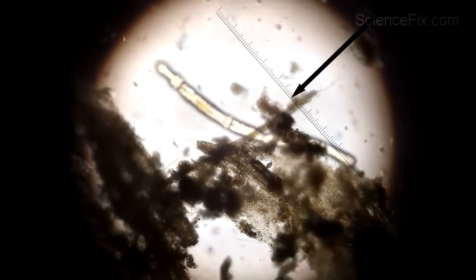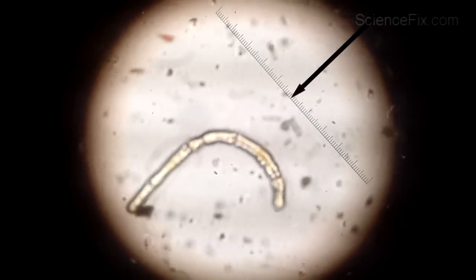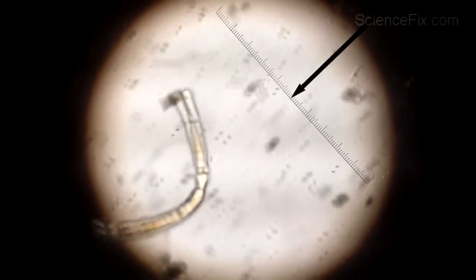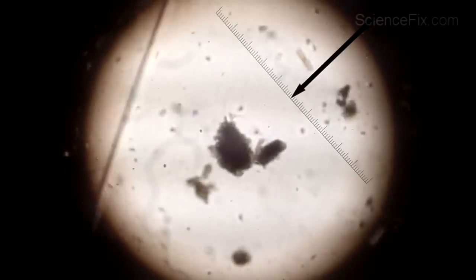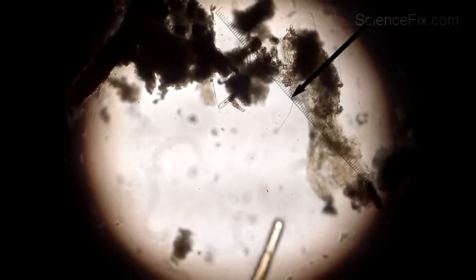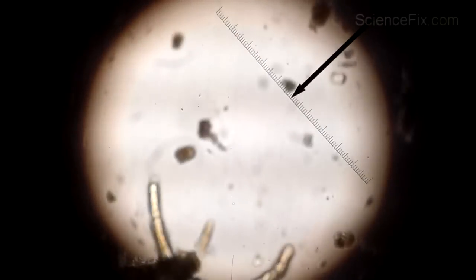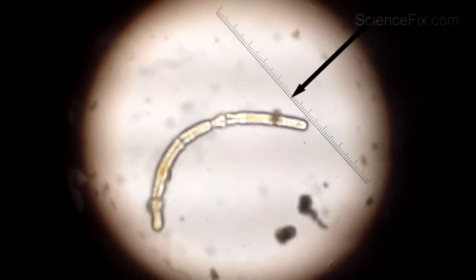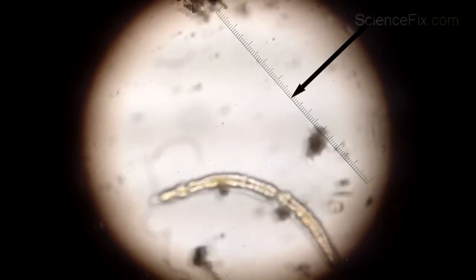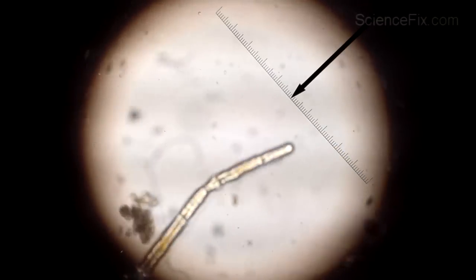It's also cool to use a little setup like this where you can record video and pictures on the smartphone and play it back later. Students are also able to share what they've seen with other students and teachers — it's a really powerful teaching tool. This microorganism is just really active and it's really neat to see an up-close view of it.